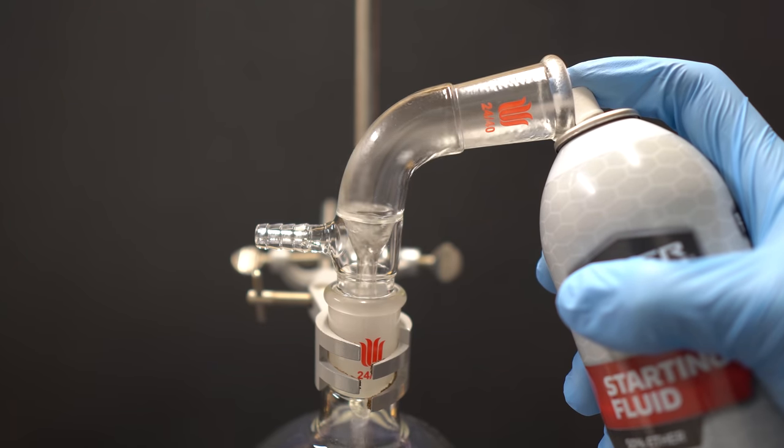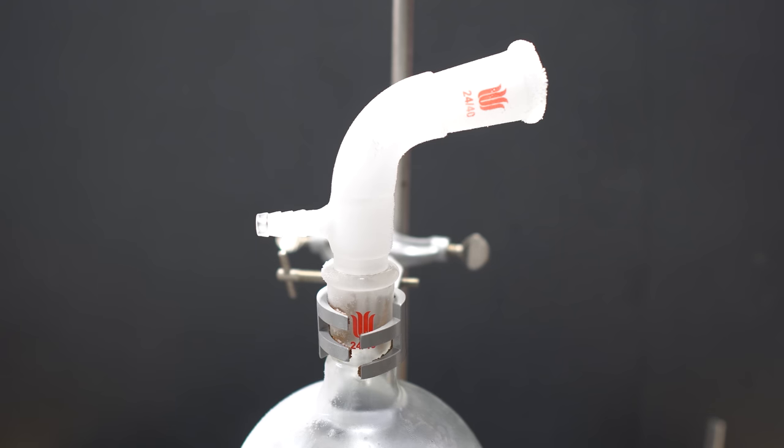I also put a different attachment to the round bottom boiling flask as it reduced the amount lost. Make sure you do this in a well ventilated area or like I did, I went outside. It is recommended that you put the starting fluid into the freezer as that will help a lot.